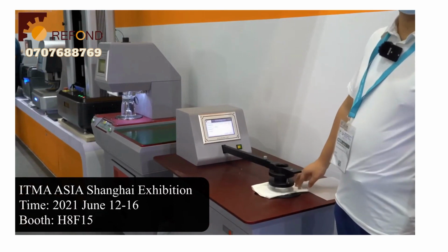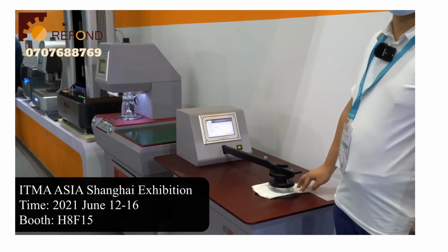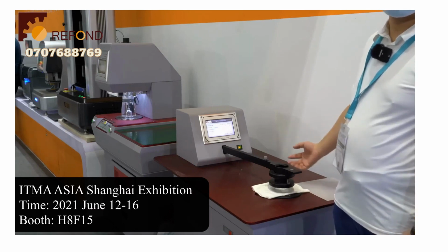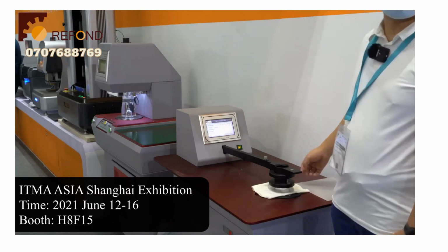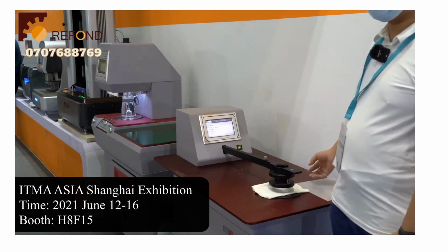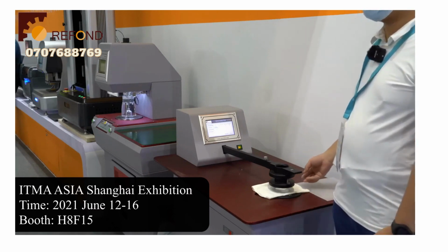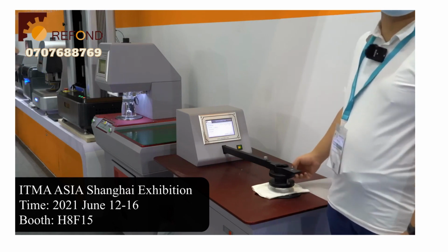The most important innovation for our new machine is that you can use an external calibrated airflow sensor or an airflow meter to calibrate the airflow for this machine. This produces better traceability than the traditional method of calibrating. The traditional method requires different sets of plates, which is labor intensive, and it also does not provide a lot of traceability. Now we can use flow rate meters to calibrate this machine.